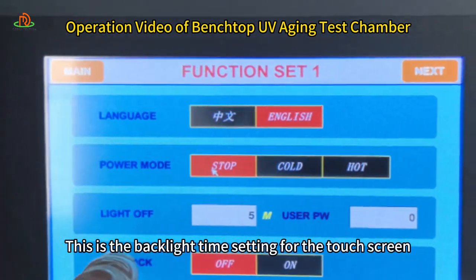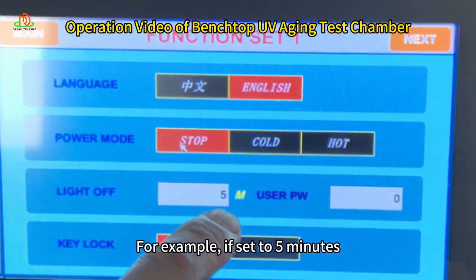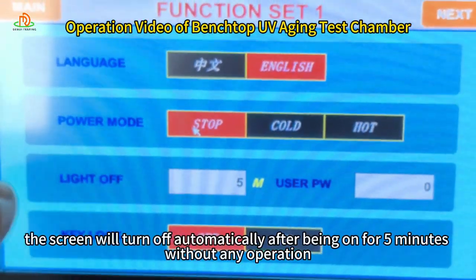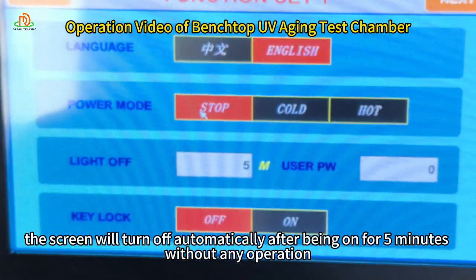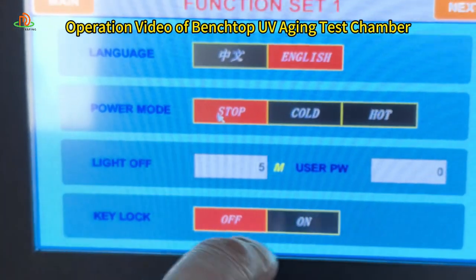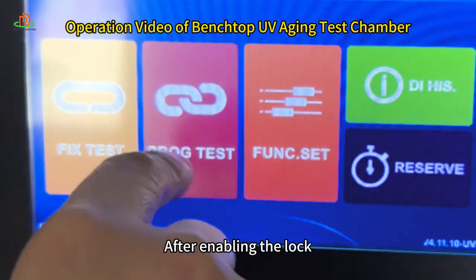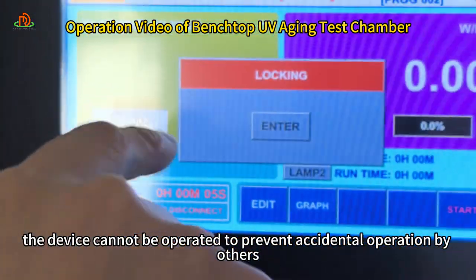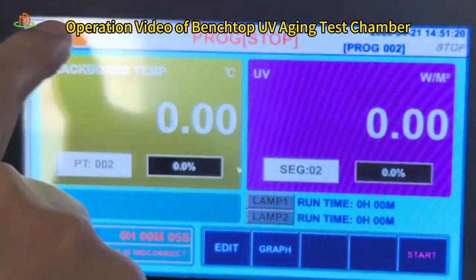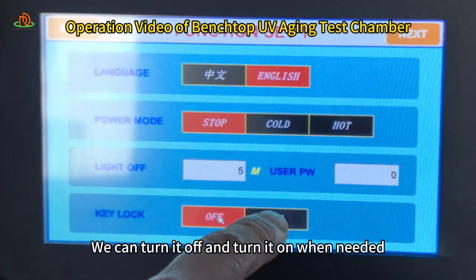This is the backlight time setting for the touch screen. For example, if set to 5 minutes, the screen will turn off automatically after being on for 5 minutes without any operation. This is the lock settings. After enabling the lock, the device cannot be operated to prevent accidental operation by others. We can turn it off and turn it on when needed.